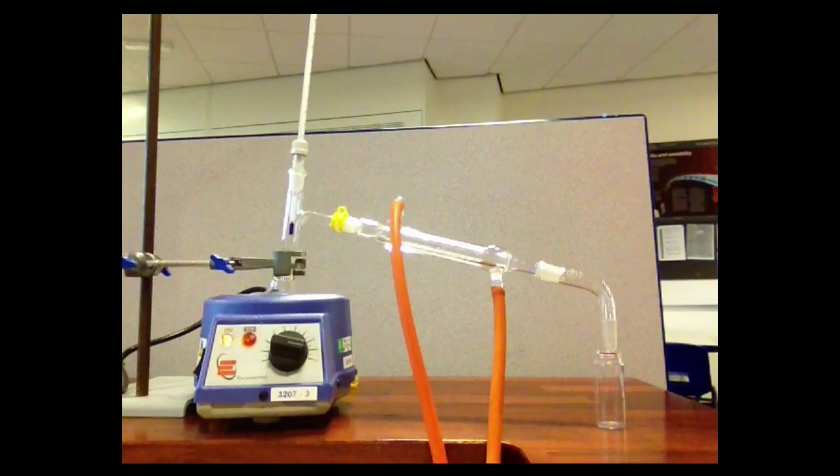In general, you'll have more than one vessel ready to receive the liquids so that if something boils off at a temperature below the product you want to collect, you can collect that first and then move it out of the way as the temperature starts to rise again, and put another vessel underneath the end of the condenser there, and just keep on doing that until the liquid that you're intending to collect starts coming across at its boiling point.